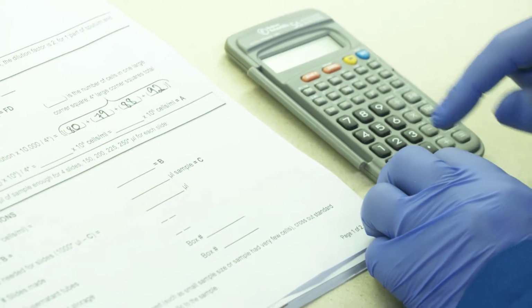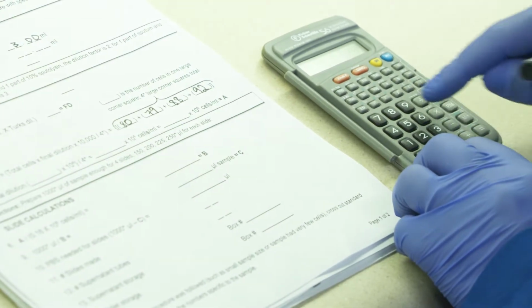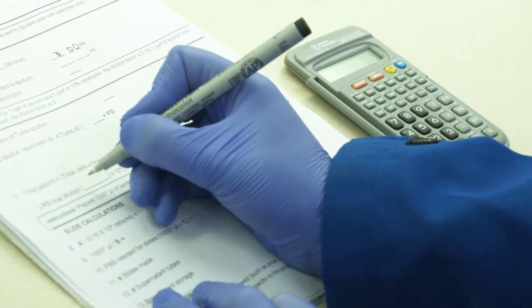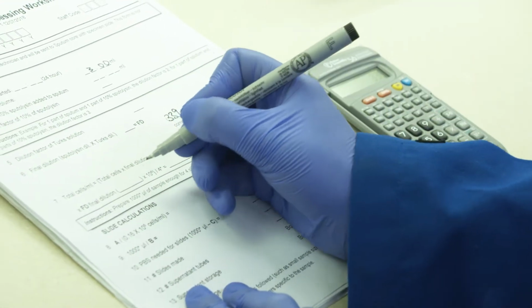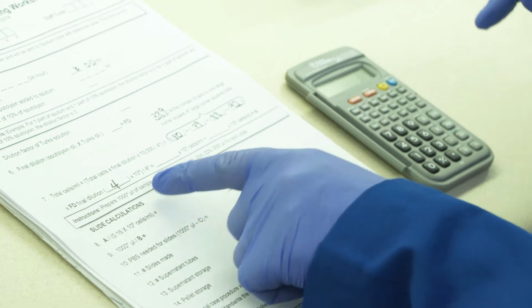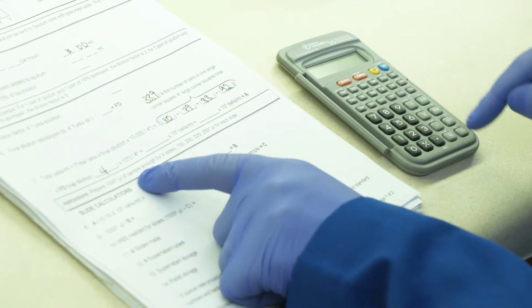The calculation for 160,000 cells per ml is as follows. 1. Cells per ml equals the cell count in the 4 large corner squares times the dilution number times 10,000 divided by 4 large corner squares. Your total dilution is 4 because you diluted 2 times with sputolysin and 2 times with Turk solution.